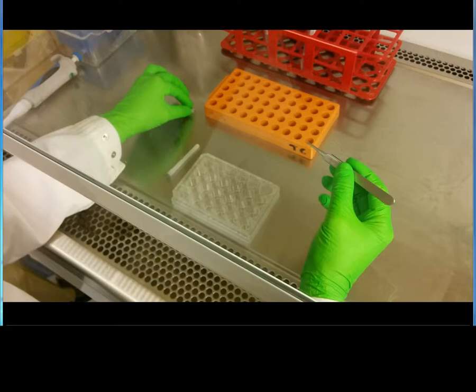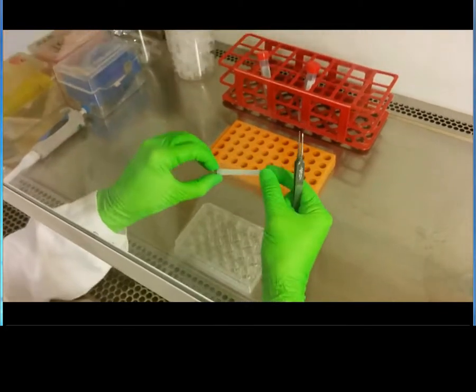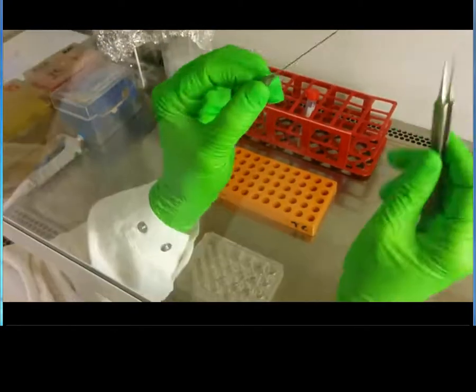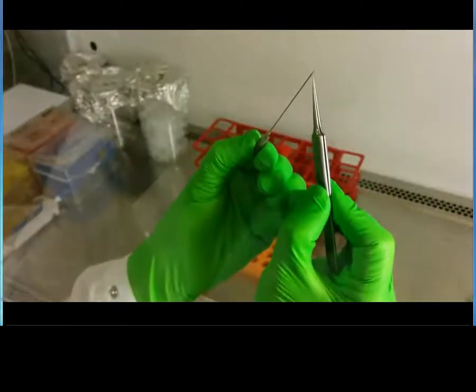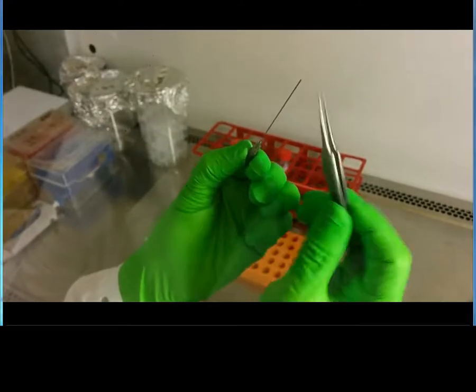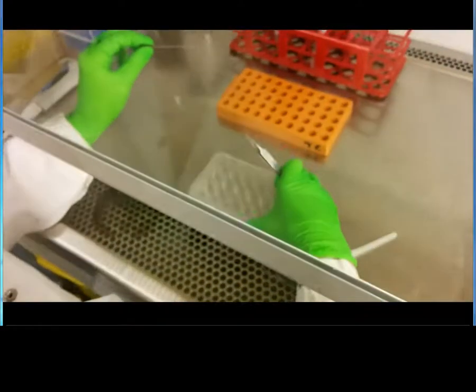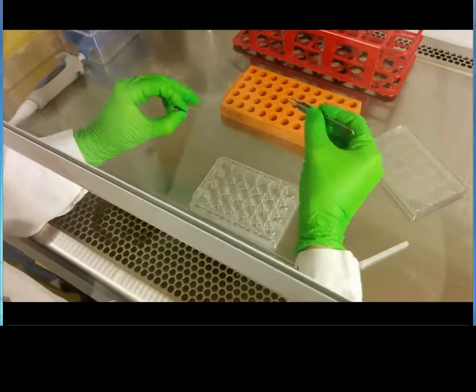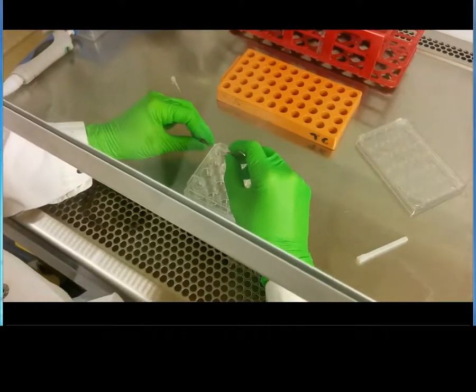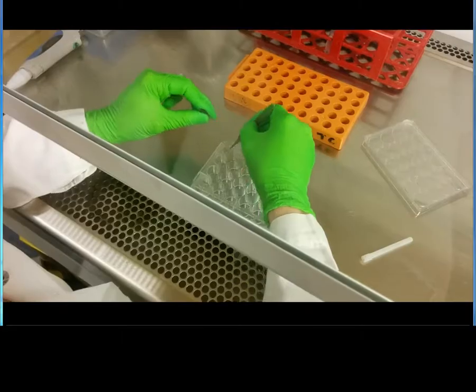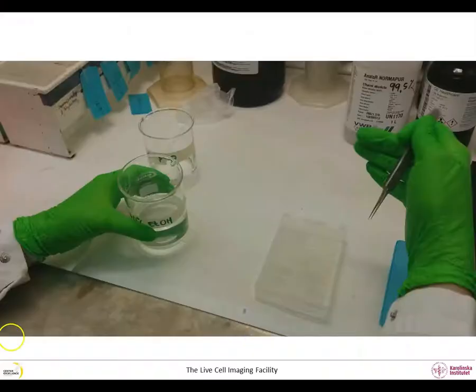It's not always easy to pick up a cover slip from a well. A tool to help you with that is a needle of which you bend the tip a little bit with the help of your tweezer. Now you can access your well and easily fish out your cover slip and grab it with your tweezer. Thank you for your attention.